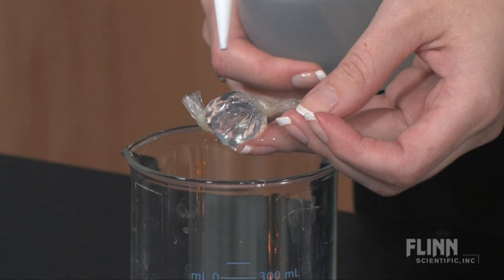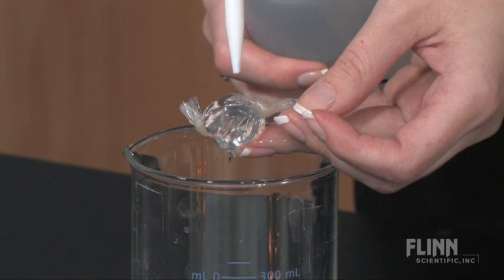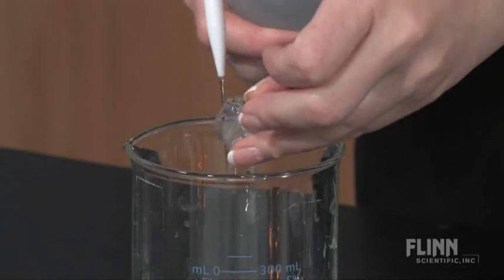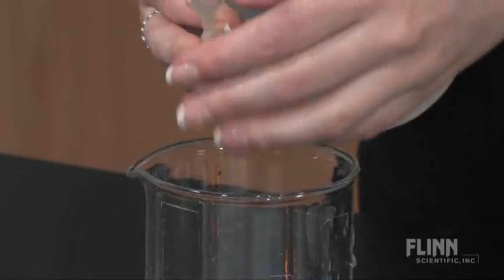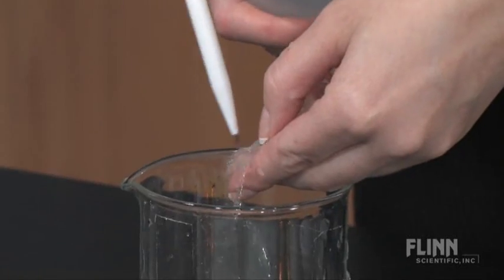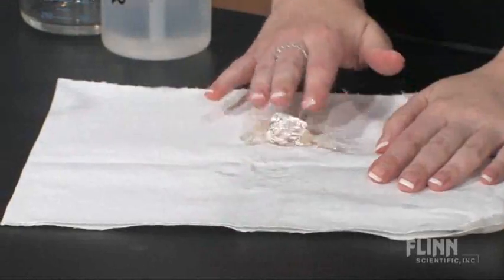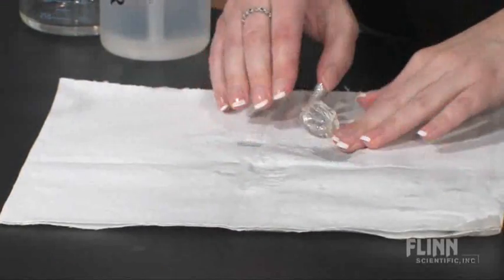It is important here to secure both ends of the bag tightly. Rinse off the outside of the bag with distilled water and pat it dry. Rinsing is important to remove any starch solution from the outside of the bag that could yield a false positive result.